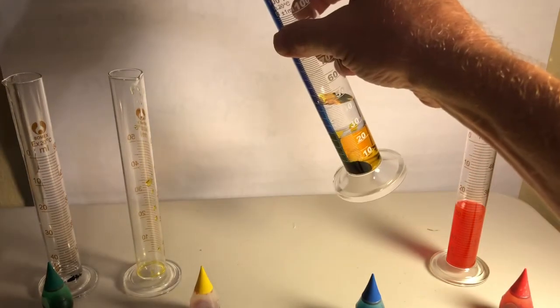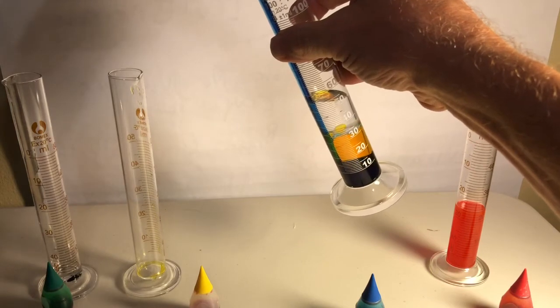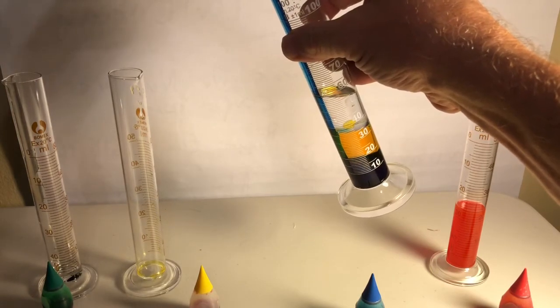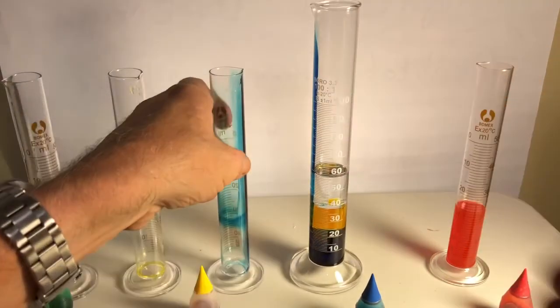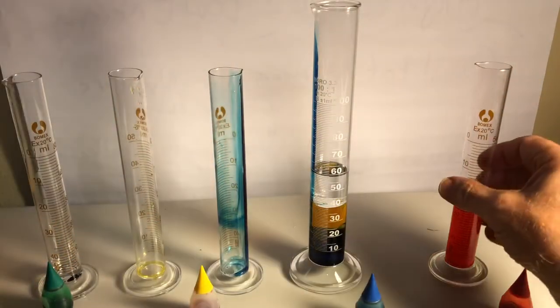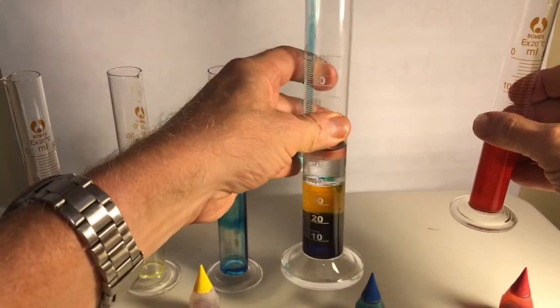What the? What is going on there? That's kind of awesome. And last but not least, ooh, something weird's happening there.